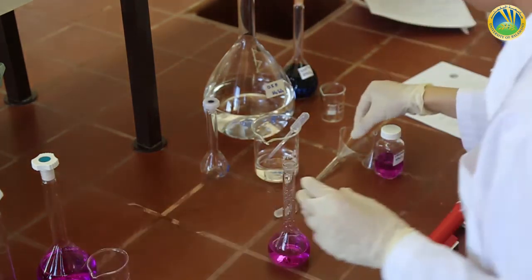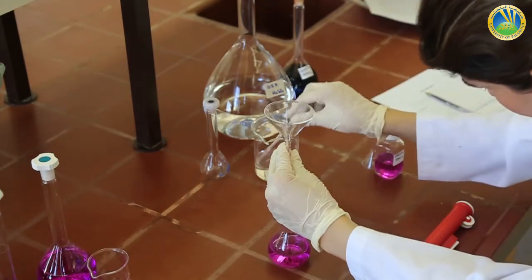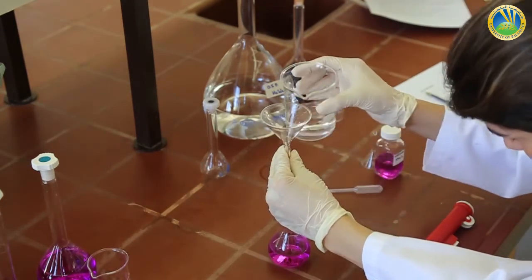We complete the volume with acid, H2SO4.